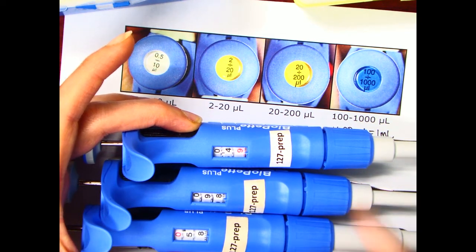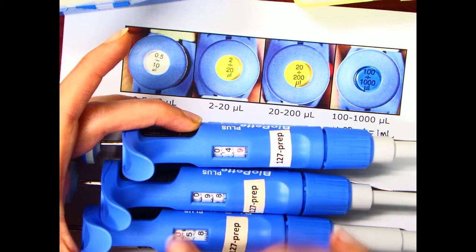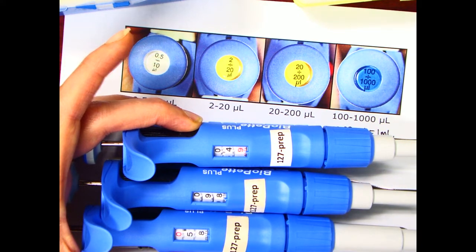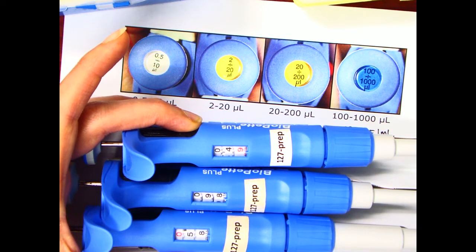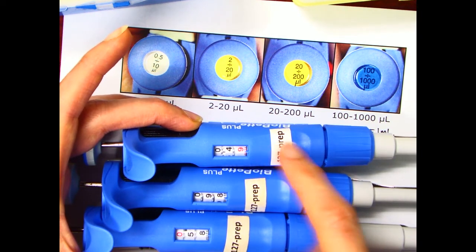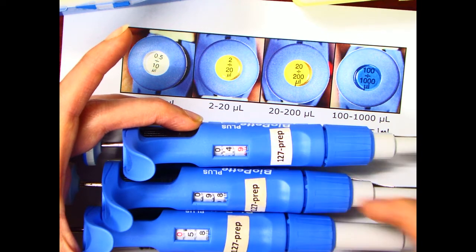The important thing I wanted you to see is that some of them have all black numbers and some of them have red numbers, and the red numbers go with different punctuation marks. The red numbers are intended to make you aware that you'll need to pay more attention to where they are and what that tells you about the volumes.